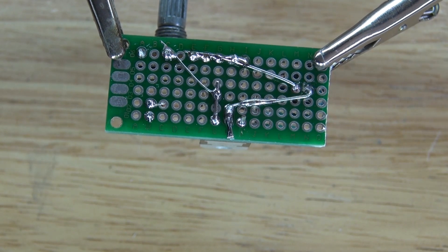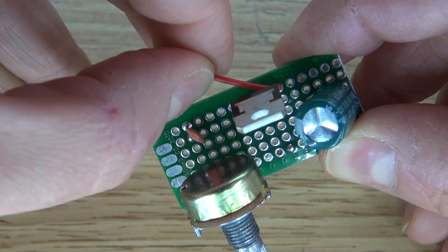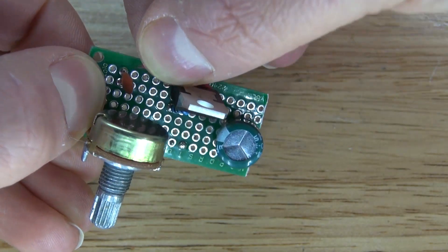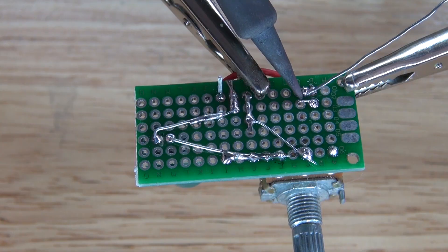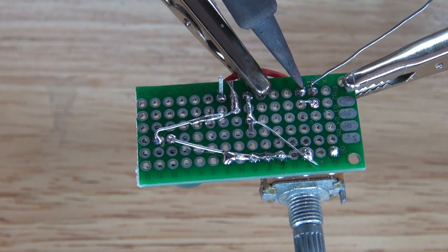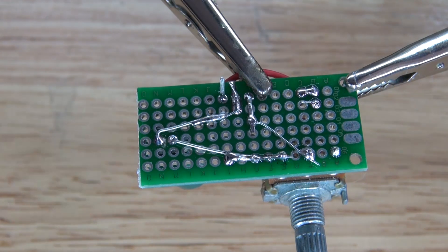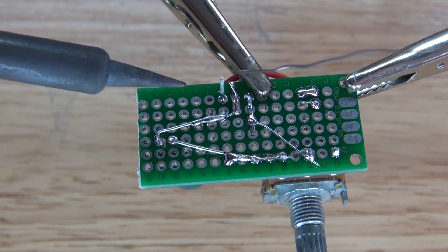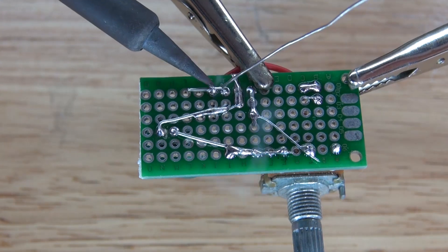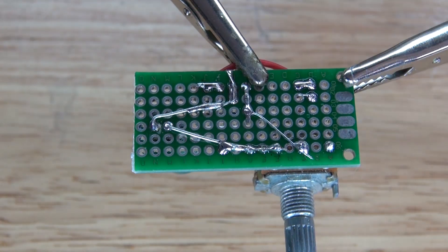It should look just like this. Next I'm going to take a bridge wire and solder it to the input — positive of the voltage regulator — and connect it to the ceramic capacitor. Solder it into place, then solder bridge it to the capacitor. Now solder the other bridge wire, and bend the input lead of the voltage regulator and solder bridge it together. Cut off the excess, and it should look just like this.